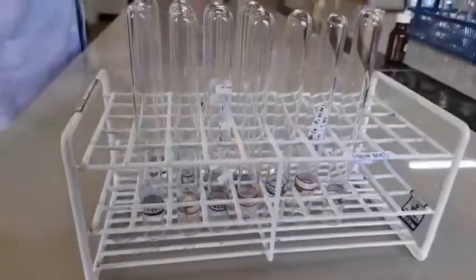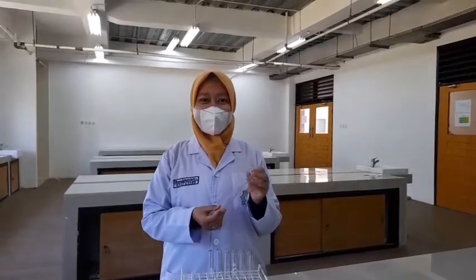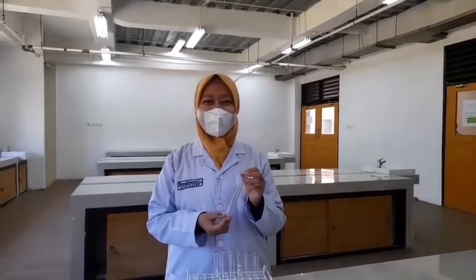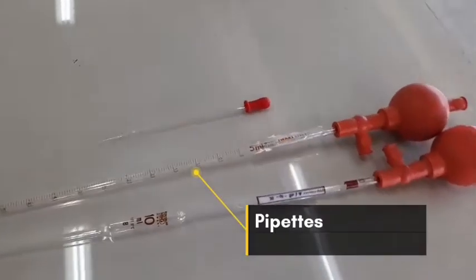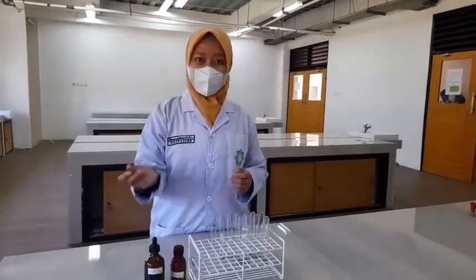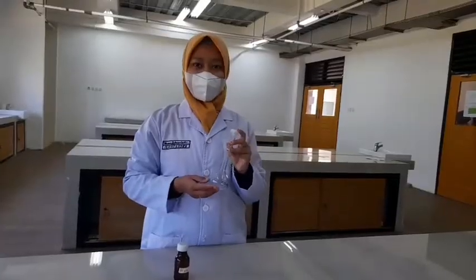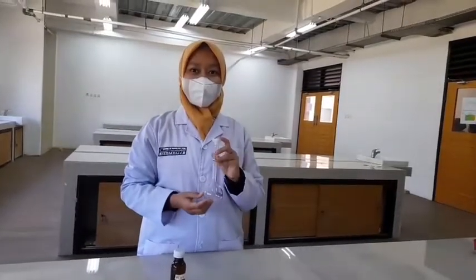Beaker, used to hold or mix chemicals. Test tube, used for storing, mixing, and heating small amounts of chemicals. Pipette, used to dispense a measured volume of liquid. Flask, used to boil a solution.